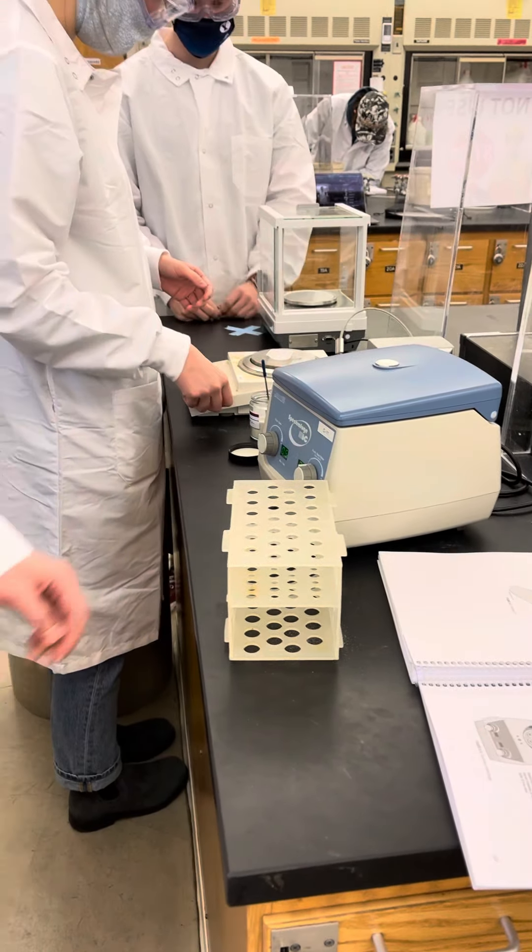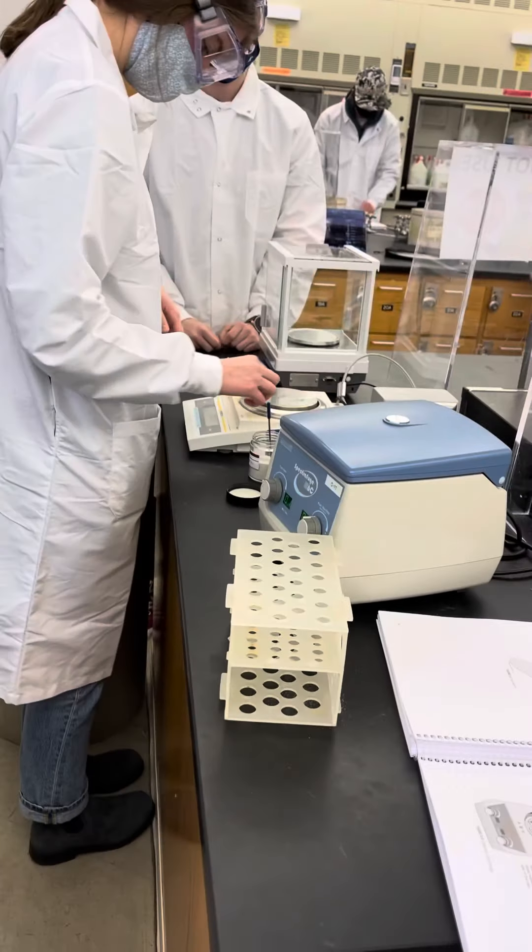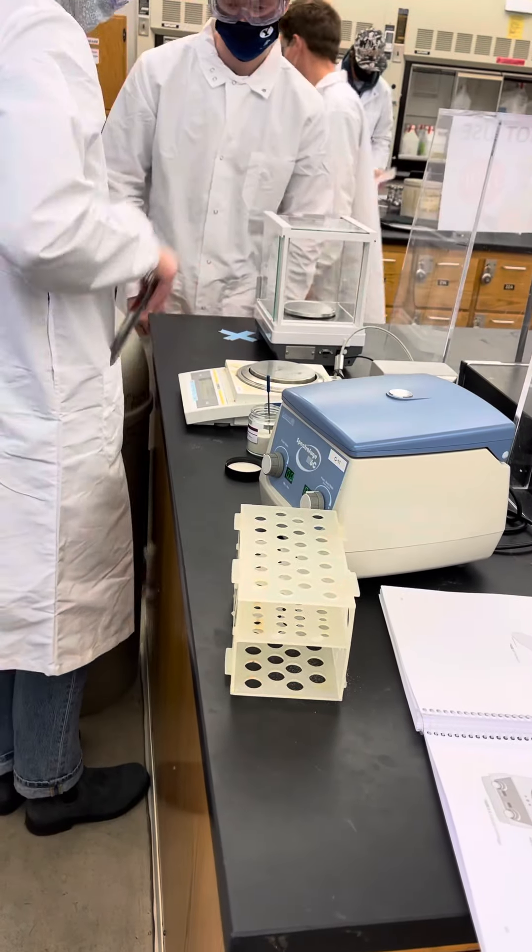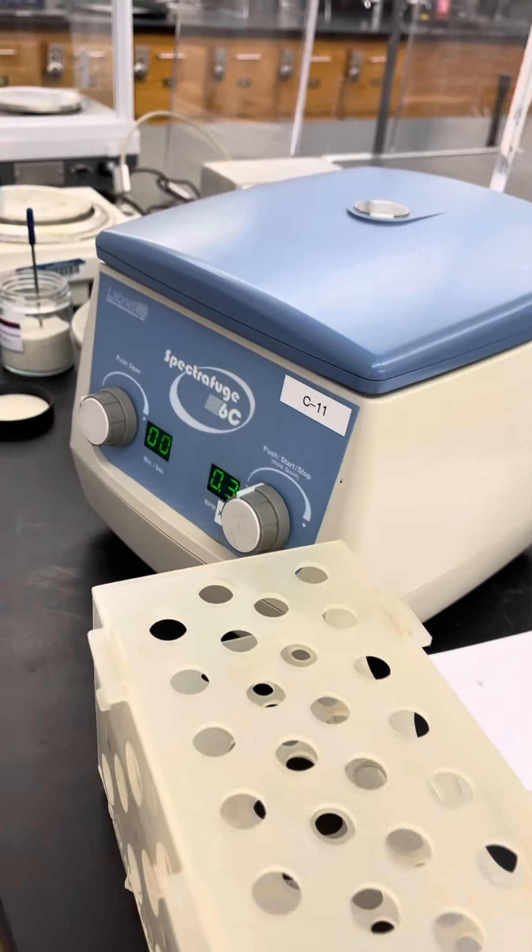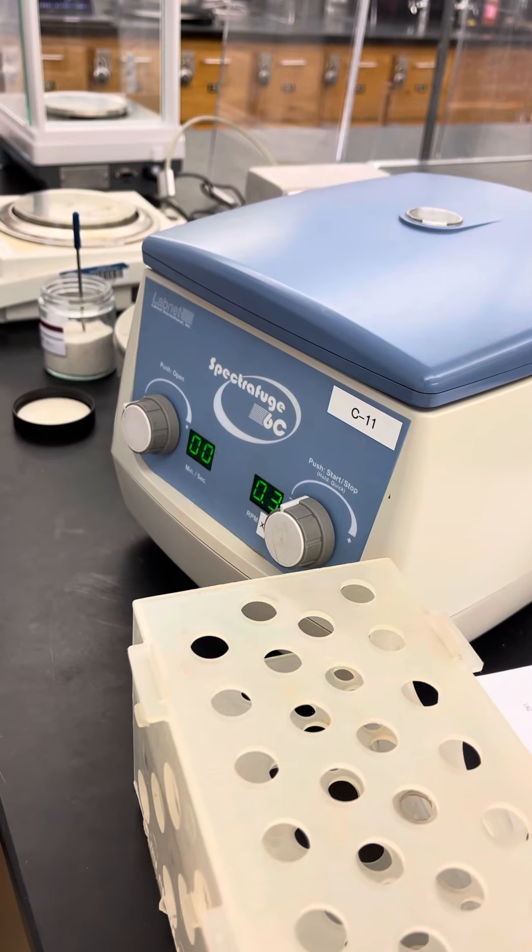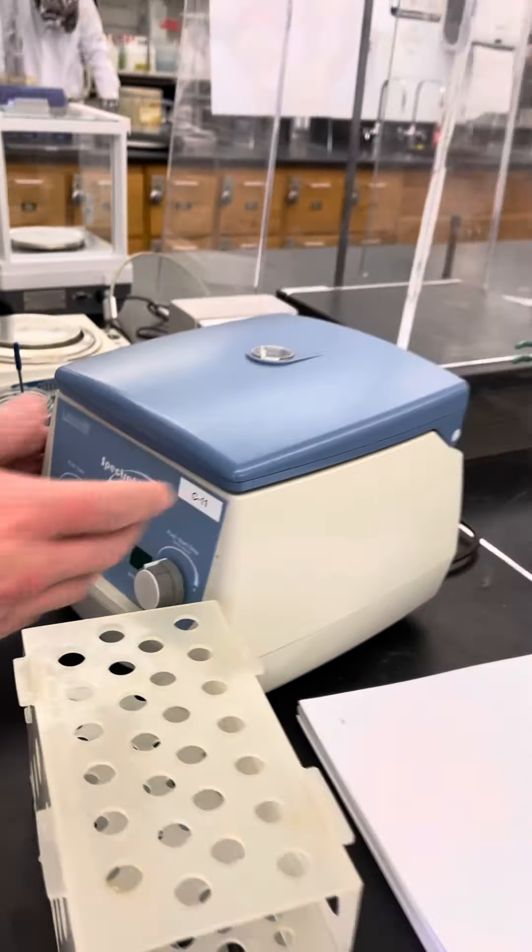And then you're going to wait for the display to start flashing before you open it up. As you can see, it's flashing, so it's ready to open. So you're going to open it. Perfect.